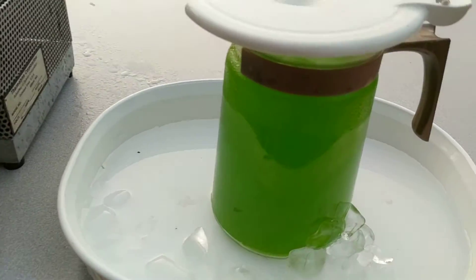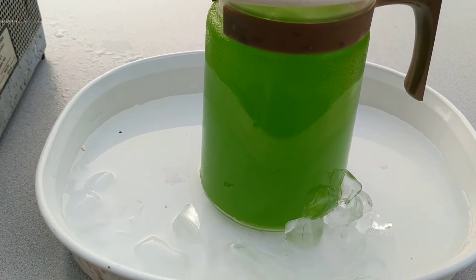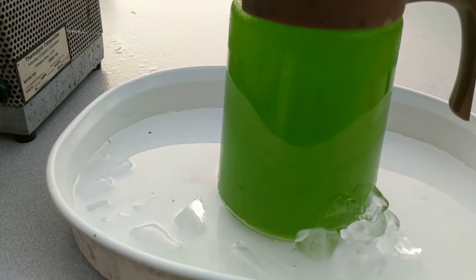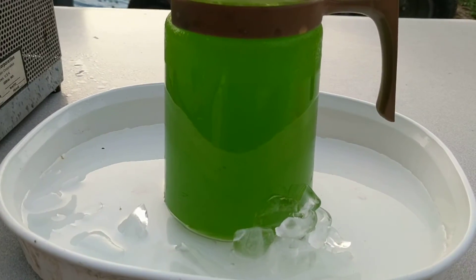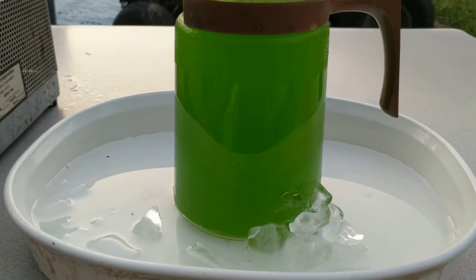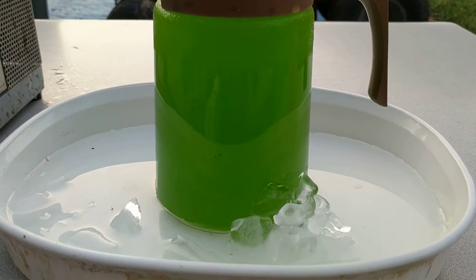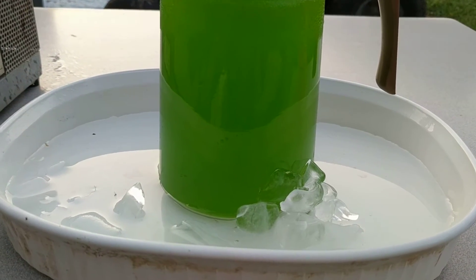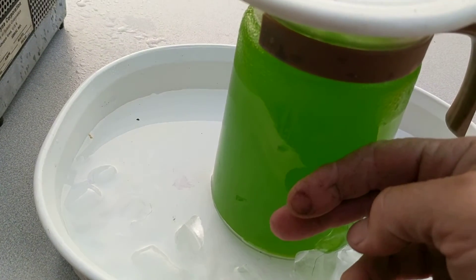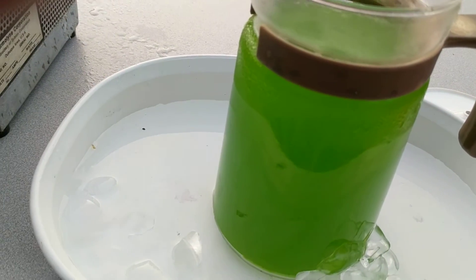Trying to get this done tonight. I finished the sulfamic and then I put about 80 milliliters of sulfuric acid in there. Then I iced it down, got it as cold as I could. I've been stirring it and I think we're right now at the point where I can run it through the filter.